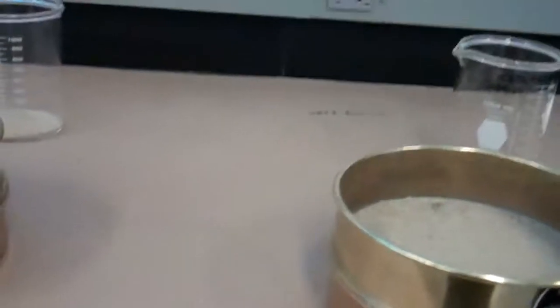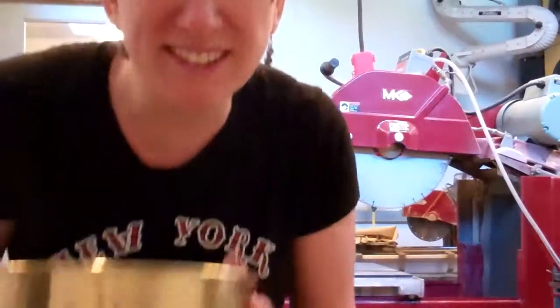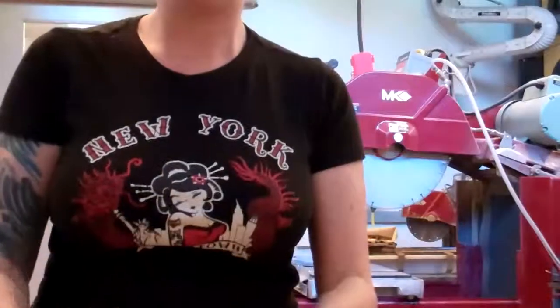And there you have it — dry sieving. Okay, so I'm going to do one last round of dry sieving. I already got all the fine particles, but now I want to get any coarse ones out and separate those from what we're looking for. We are looking for particles that are in between 125 and 250 micrometers. Everything on top is too coarse to go through the holes in the sieve and we don't want that. Whatever's in there we are going to keep to eventually be water sieved.